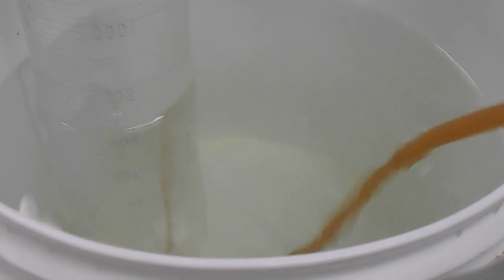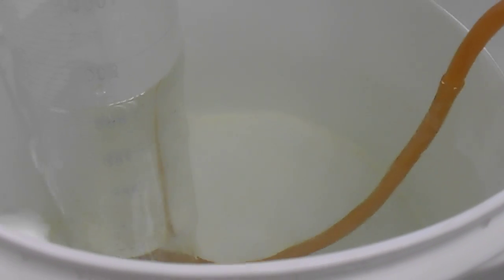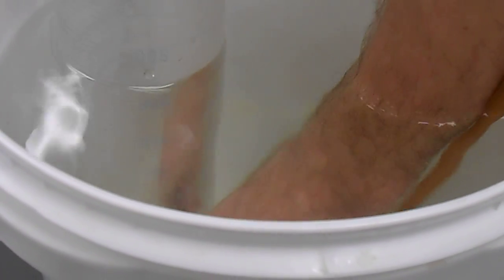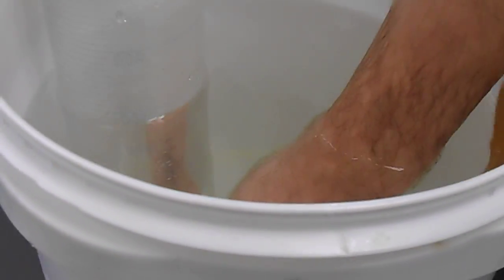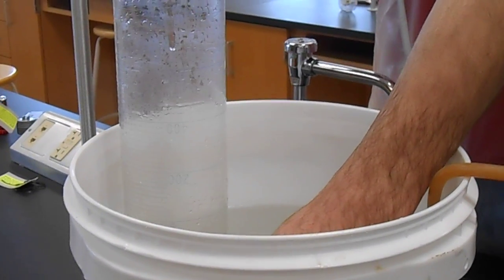All right, lovely assistant. Reach down, keep the hose at the bottom of the tube, and pull the tube up where the camera can see that we have filled the entire 2-liter graduated cylinder with gas. Stop right there.